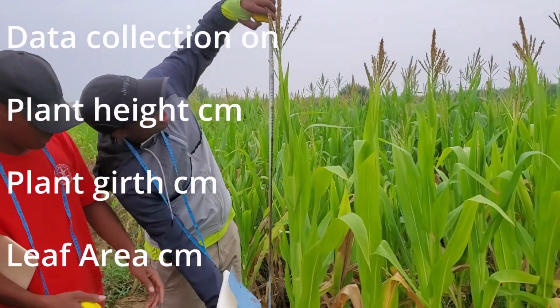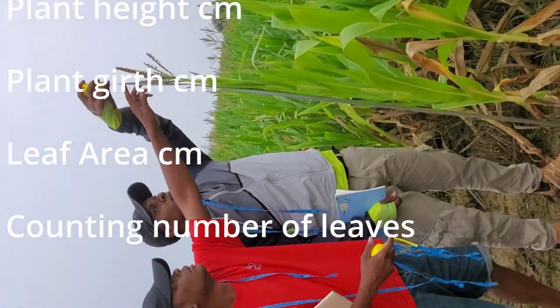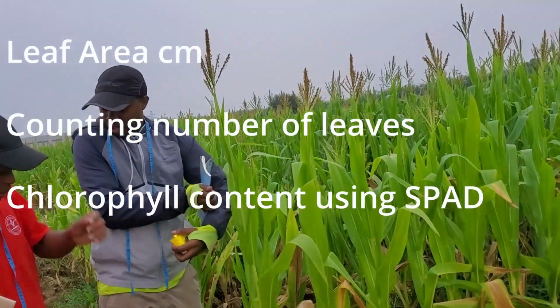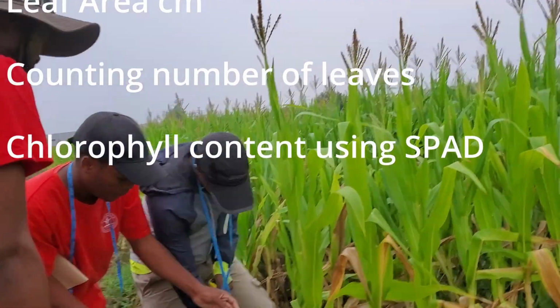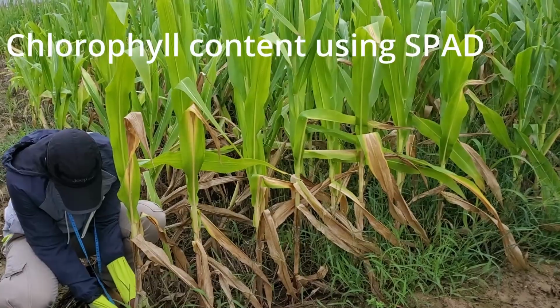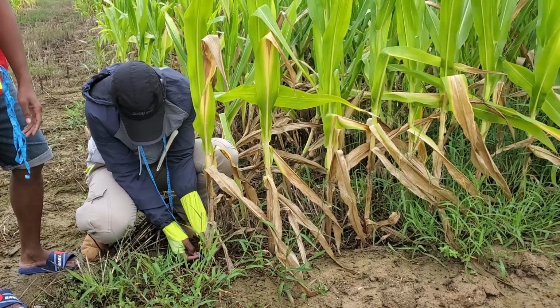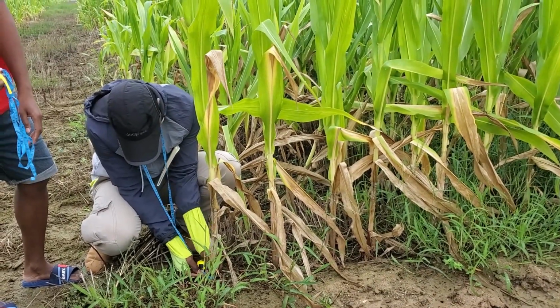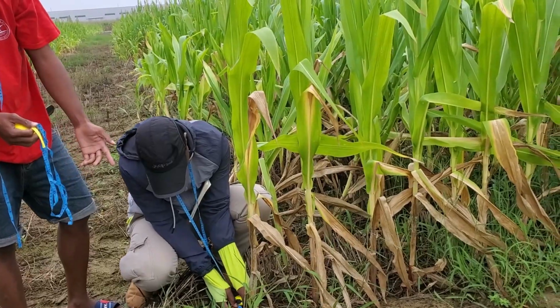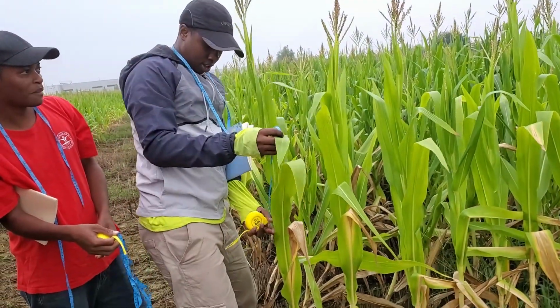Let's concentrate on plant height. Do you measure with the tassel or what? To the tip. Okay. And this is the first parameter, plant height. Also the girth. Here from the bottom. Do you measure in inches? No, centimeters. So this is 9 or 10? This is 9. So plant height, and then leaf area.